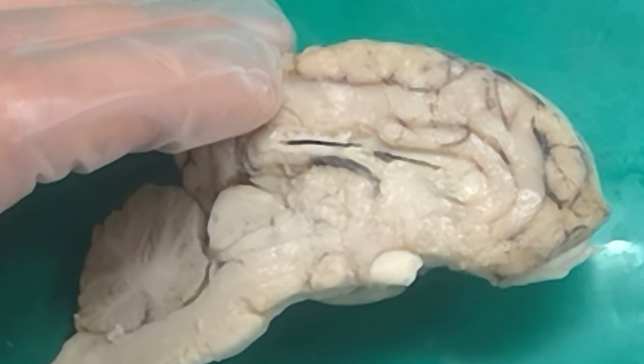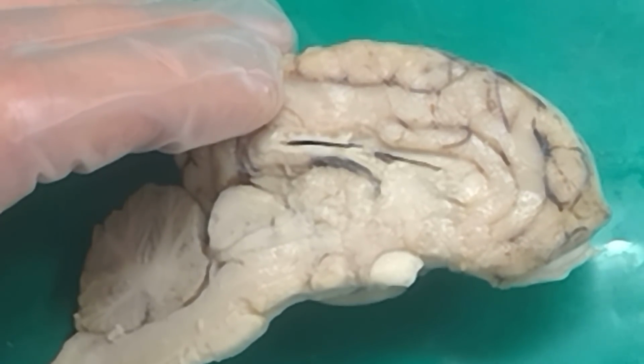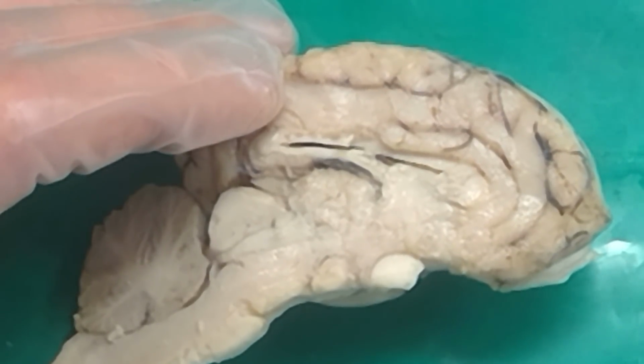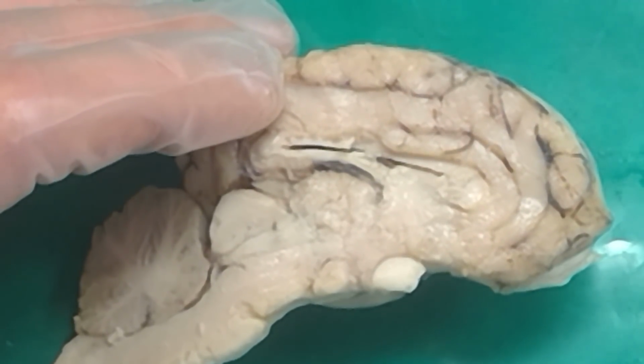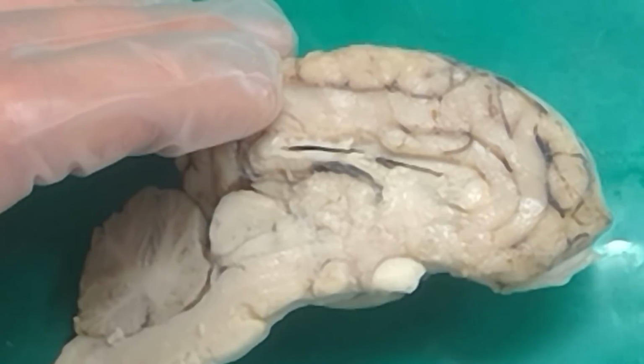If I'm asking a nucleus type thing, then it could be the lateral geniculate nucleus, it could be the habenula. I don't think we'd ask a question that's actually asking the thalamus, at least not on sheep brain. I don't know if we do that with the human brain, but on the sheep brain, the thalamus I feel is way too easy. I'm not inclined to ask for the medulla because I feel like that's way too easy. I want you guys to have a little bit of a challenge.